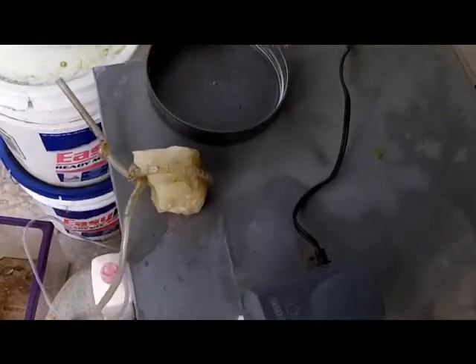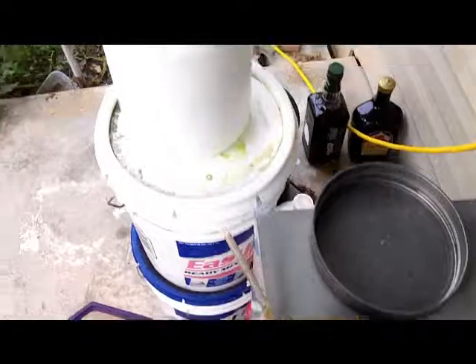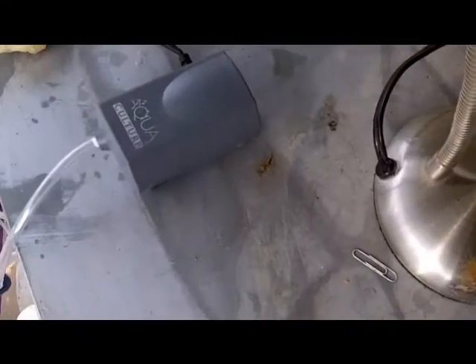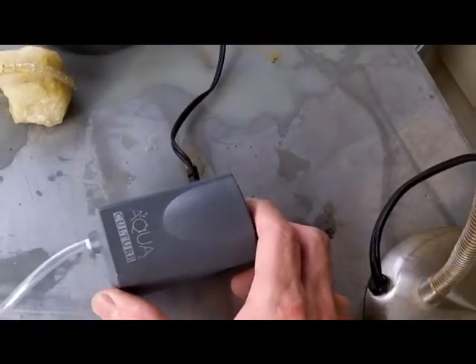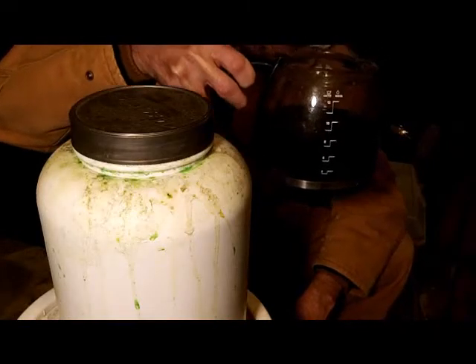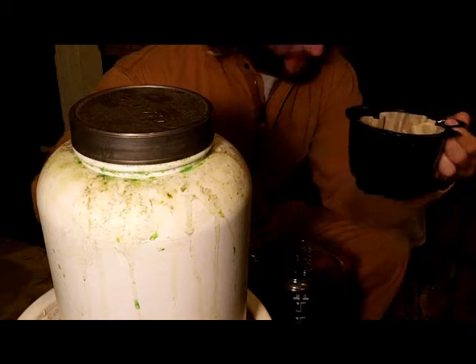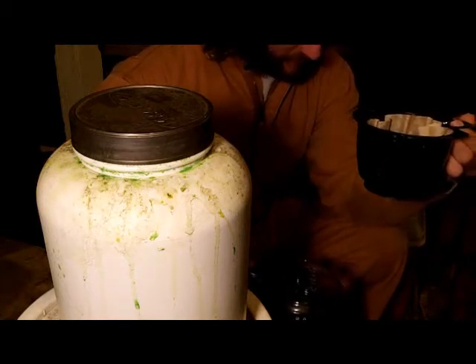An option to avoid having to use hydrogen peroxide in your digestion tank to dissolve copper, and also to reduce the amount of hydrochloric acid you need — you can get just a very small fishbowl aerator. An old coffee pot comes in really handy, and an old coffee pot maker. These things are so cheap you can get them on Craigslist, just to use specifically for this.